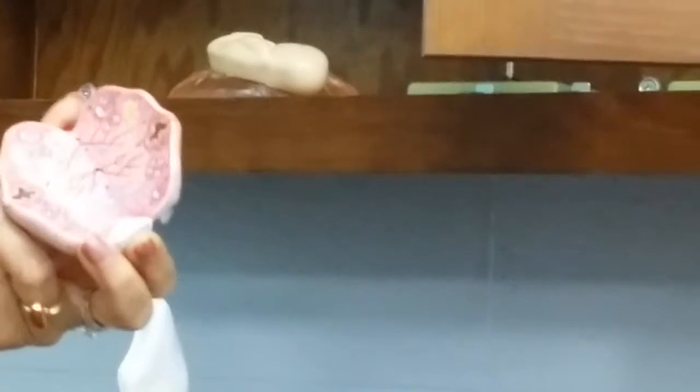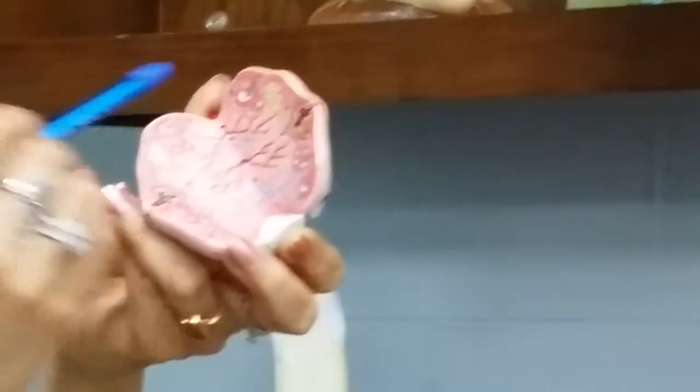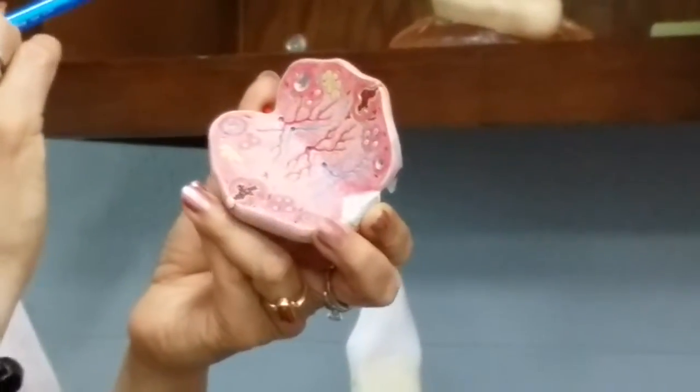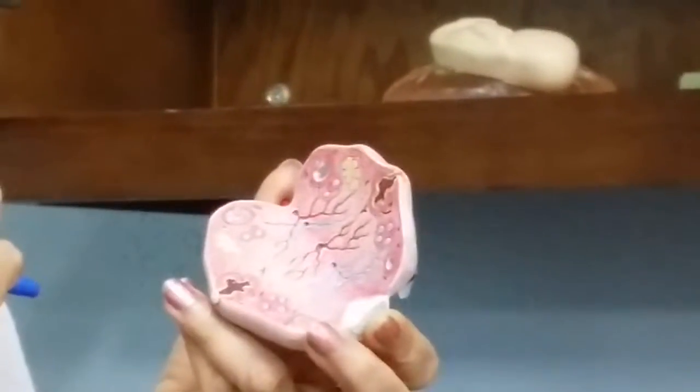If you look carefully, the Graafian follicle's structure is very interesting. It has a pretty large space, which is not empty. It's filled with fluid. The space is the antrum. And then on one side of the Graafian follicle is a little egg surrounded by its follicular cells.